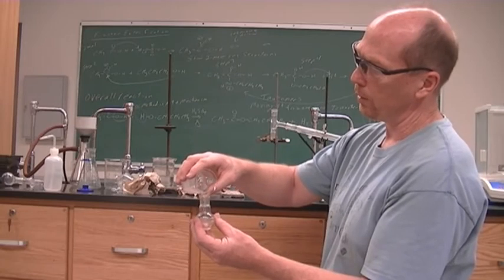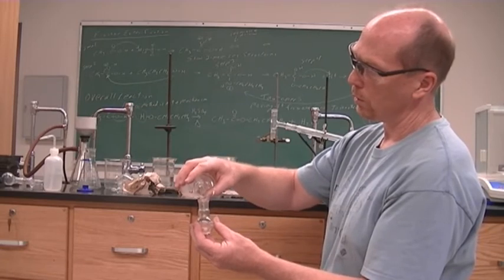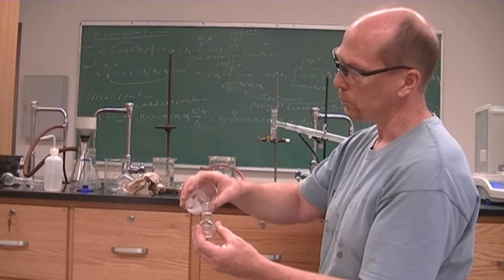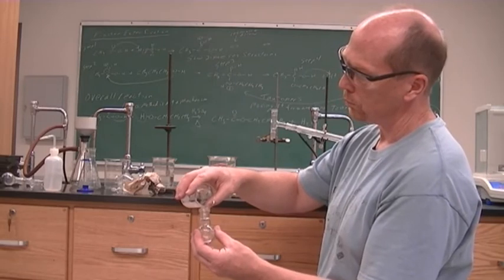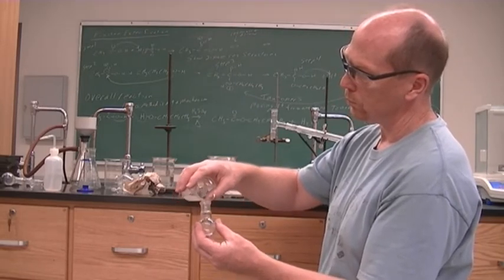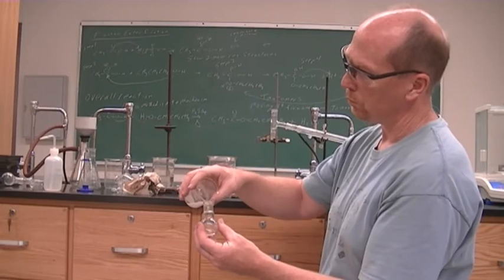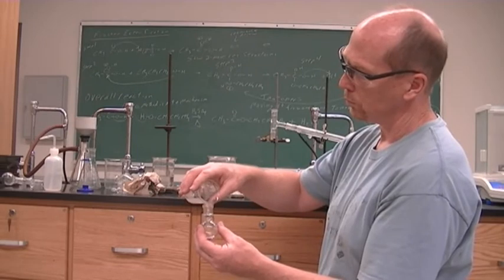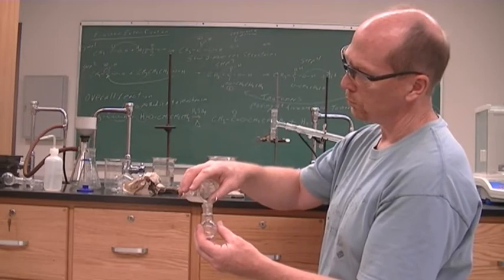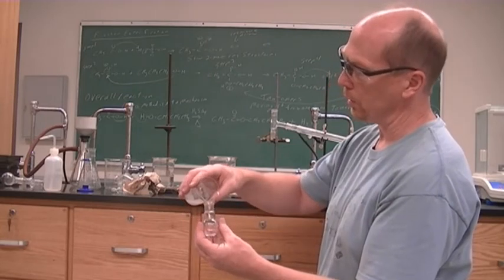The solid will remain. This will give us our boiling point and our yield.